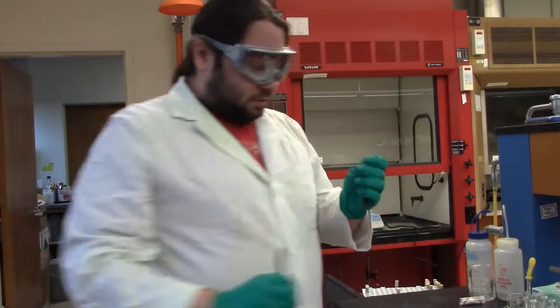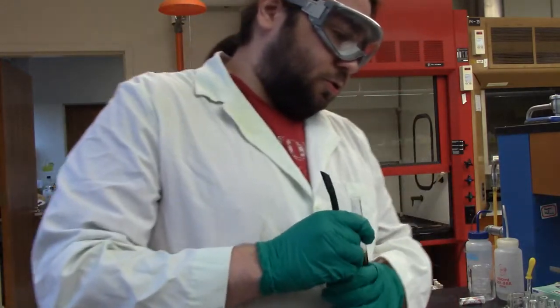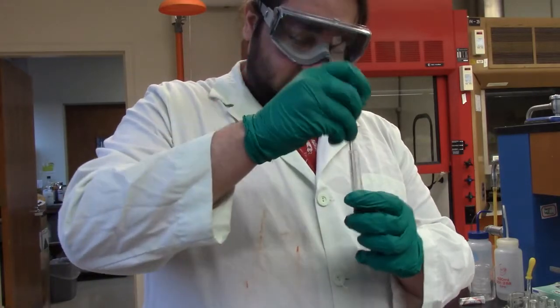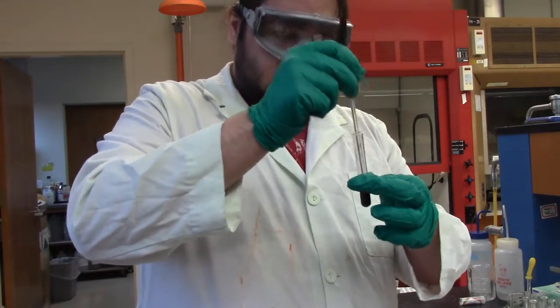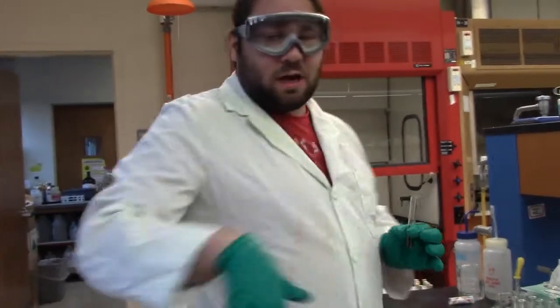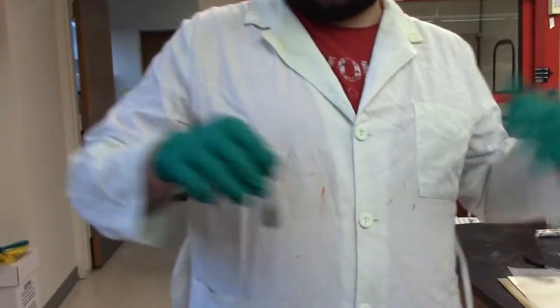Jeez. So this is to wash it. So put it in there, give it a good mix, and then we centrifuge it. So I'll do the next few steps, and I'll come back to you when it's important for you guys to see what's happening. So we'll be back in a minute.